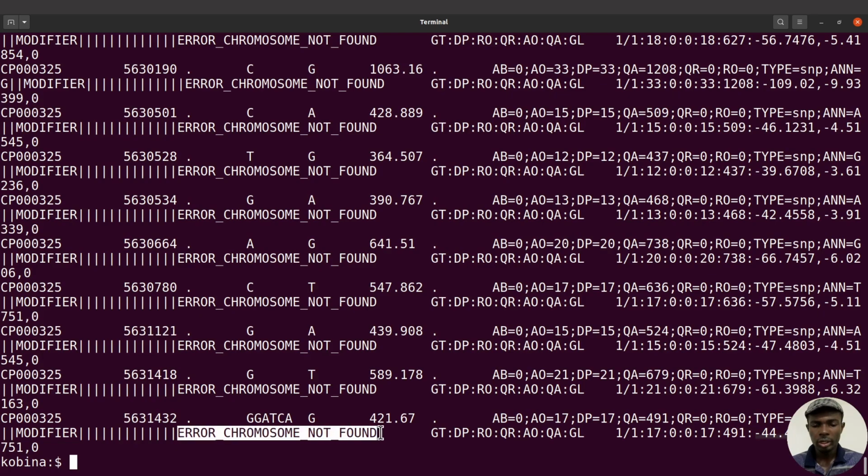Okay, so we are going to resolve it. All right, so don't worry about it. But I just thought I would let us do this first test and get this error message, and you can use that to resolve. So hopefully, if you get an error like that, then you'll be able to resolve it.